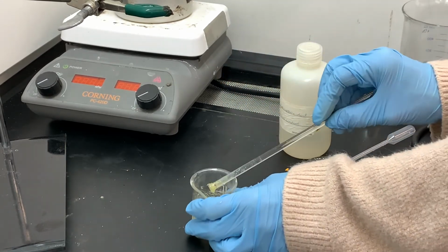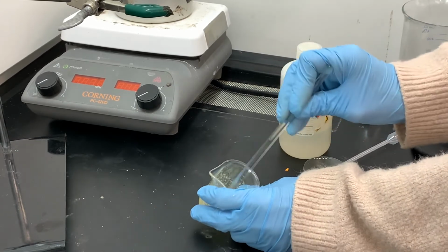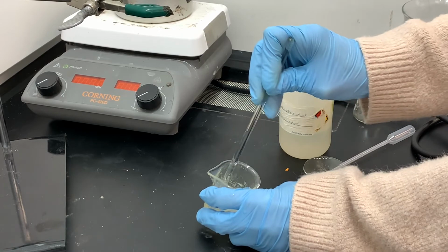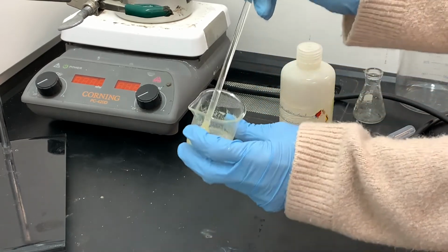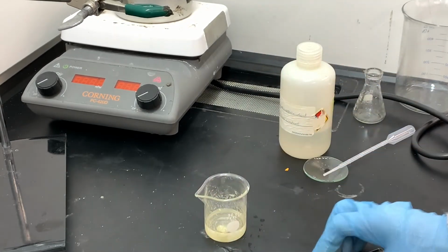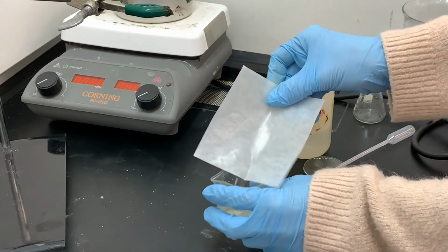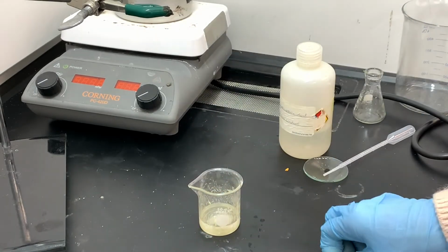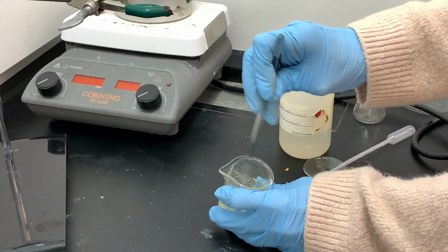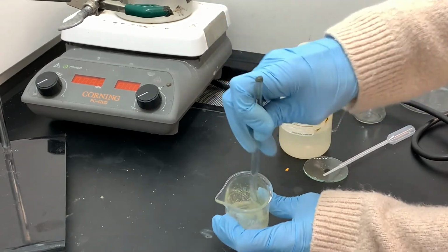So even though this actually looks pretty good, I still have one more portion of the sodium bisulfite that I haven't added yet. I think I'm just going to go ahead and add that last third just to use it, just in case there are any really small granules of manganese dioxide that I can't see. This is the last portion. And once I get this mixed in pretty well, I feel pretty confident that I didn't really need that last portion, so I feel good about this having used up all of the MnO2.